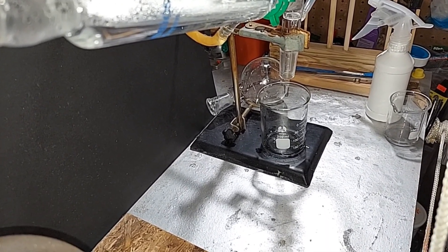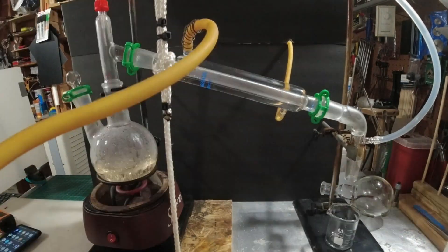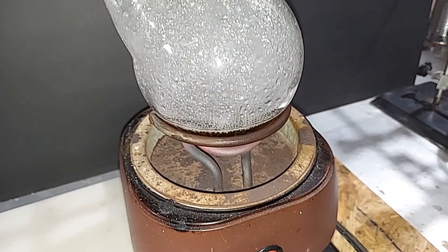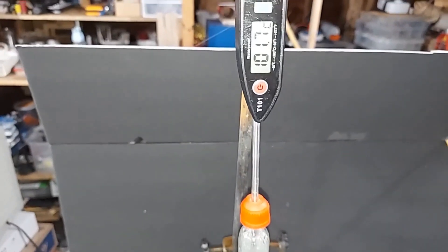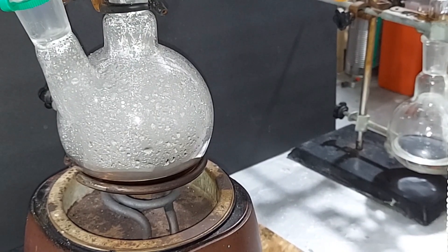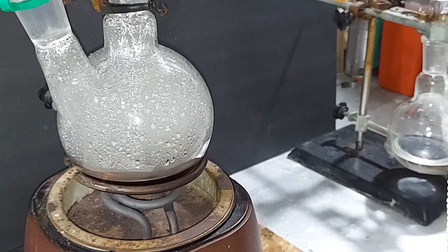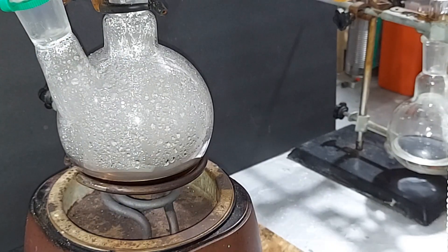It's been about an hour and a half and barely anything is coming over now — just a drip every 30 seconds — and the temperature is dropping, which means the acetic acid is almost all boiled out. I waited another half hour and almost all boiling has stopped with nothing coming over. The thermometer reads 92°C and has been holding there. With those high boiling points of the other components, I'm confident we're done. Turning it off.